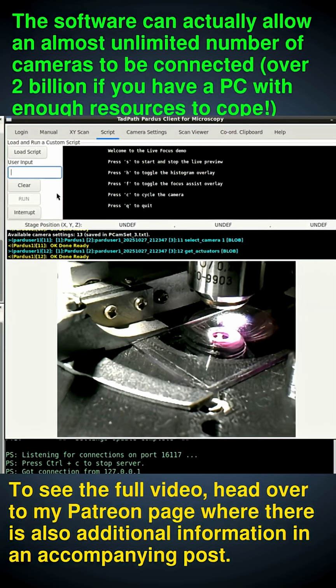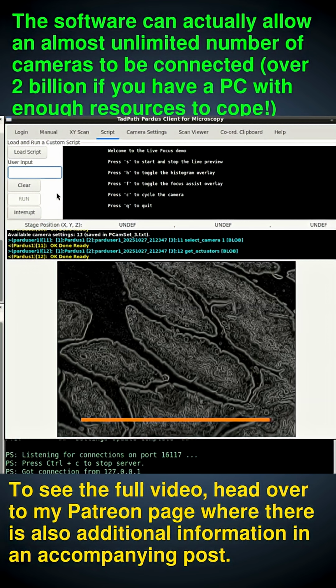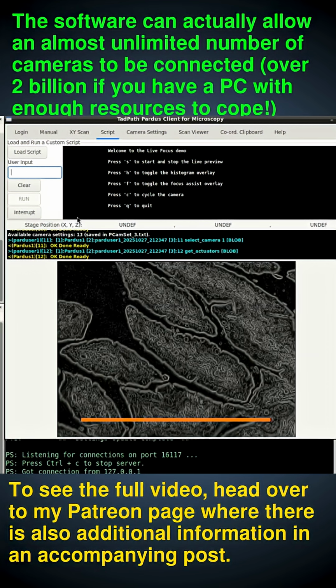Of course, you don't have to do this as an interactive preview. In your script, you could be only previewing the main camera and taking images from it. And when you need to focus, you can switch to the focus camera and then take the focus statistic from it without taking an image, because you don't have to display images. Adjust your focus by the motor control. I'm not going to demonstrate autofocus here today, but that's how you do it. You'd select this camera, get the statistic, not the image, and then change the focus, the motor, until that statistic is optimal. But you will only be looking all the time at the first camera, because you don't really need to see the focus camera's image, because you're doing it based on the statistics, which this bar is conveniently illustrating for us.